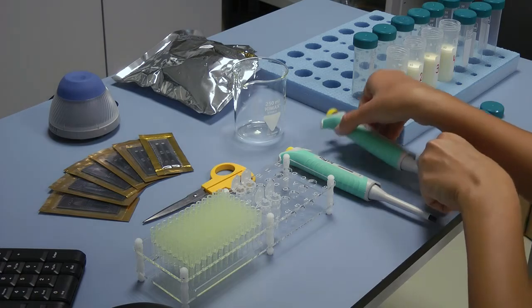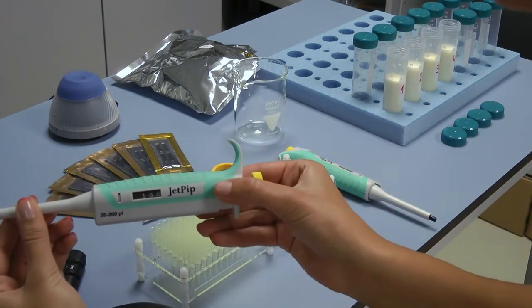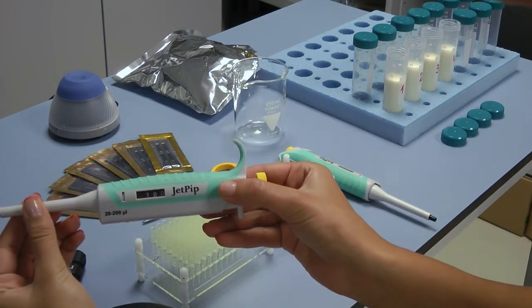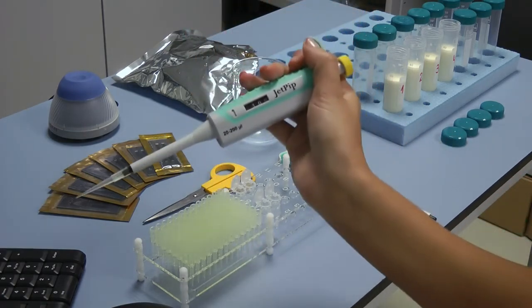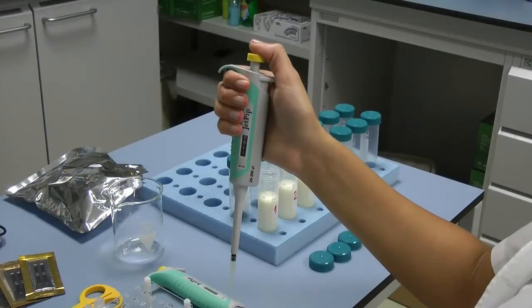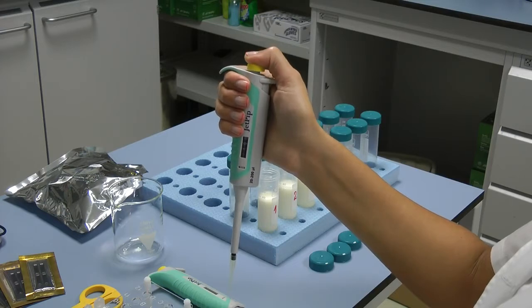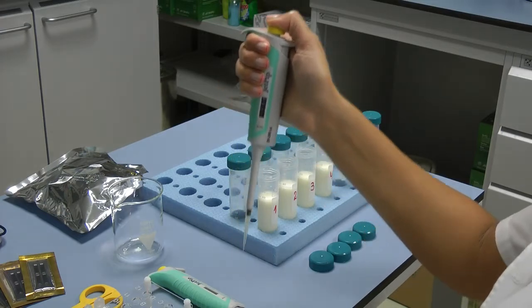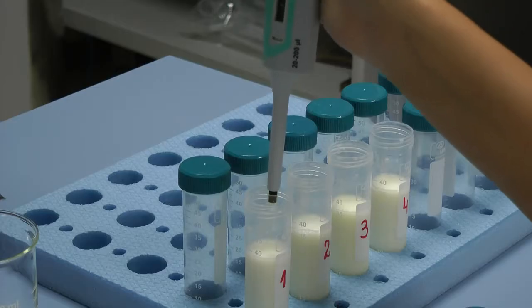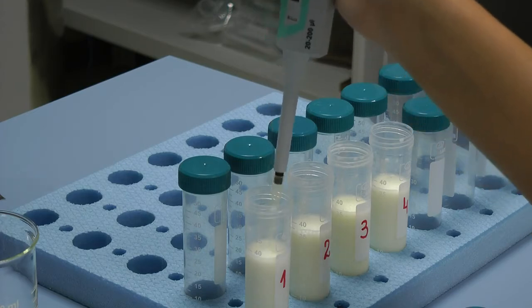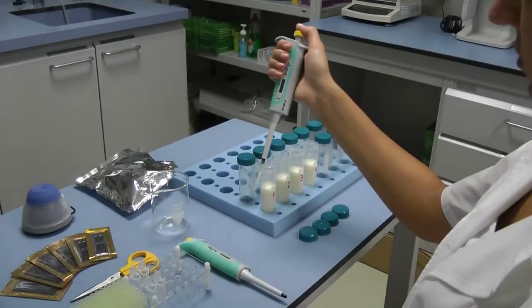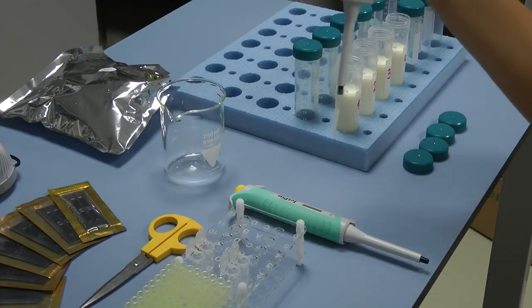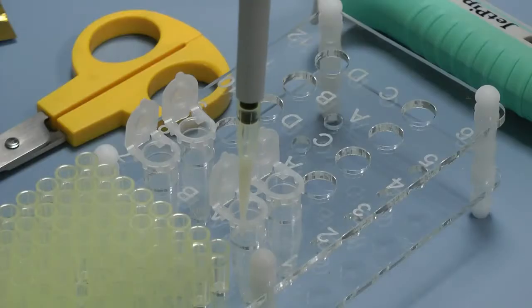Take a preliminary set to 100 µL automatic pipet. Place it vertically over one of the tips on the working rack and place the cone of the pipet in the opening of the tip by slightly pressing it. From initial position, press the working button of the pipet till the first stop is reached. Keep it pressed and dip 2 or 3 mm of the tip in the milk, smoothly release the working button and take out the tip from the liquid. Touch the walls of the bottle to remove the excessive milk.